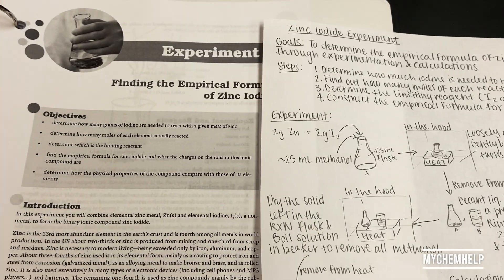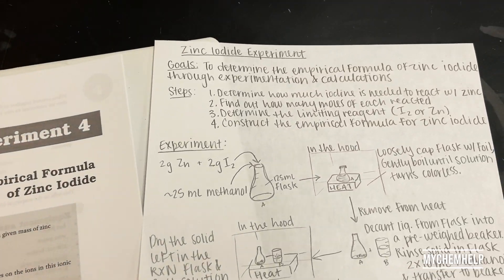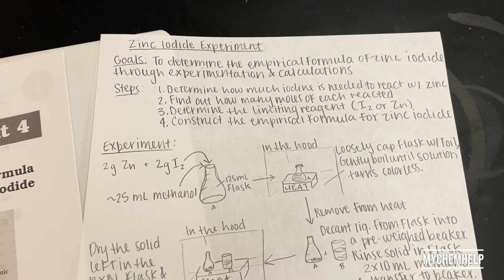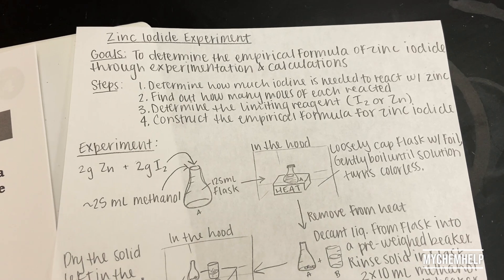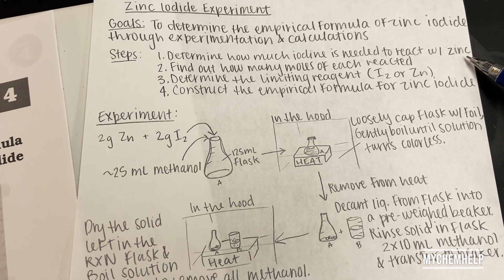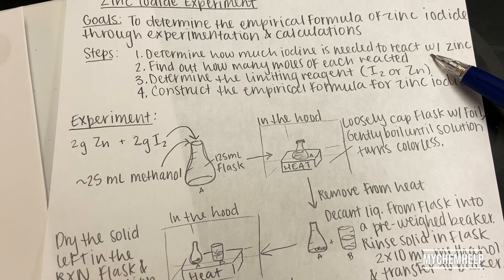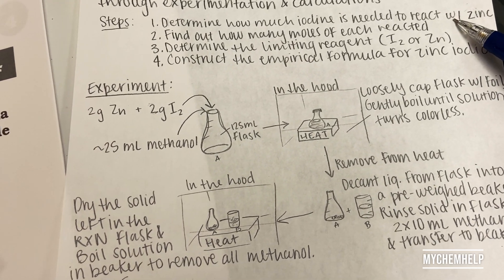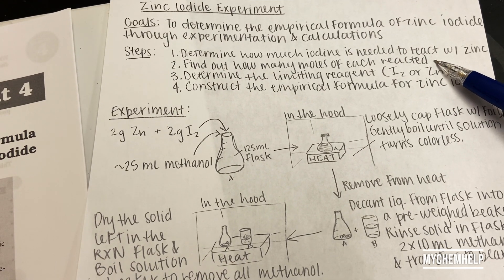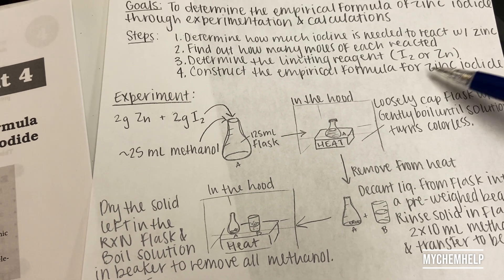Let's take a look at the zinc iodide experiment. The goal of this experiment is to determine the empirical formula of zinc iodide through experimentation and calculations. One of the steps to reach this goal is determining how much iodine is needed to react with a set amount of zinc, and how many moles of each reacted.